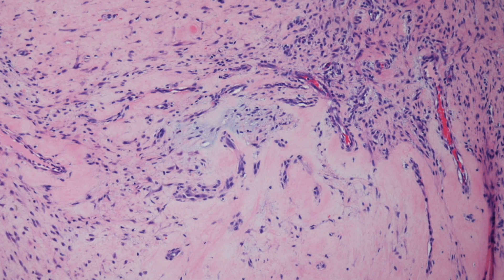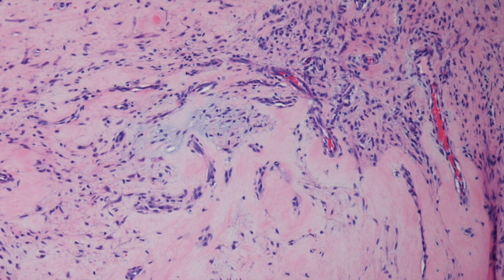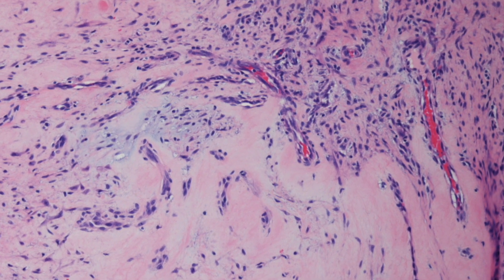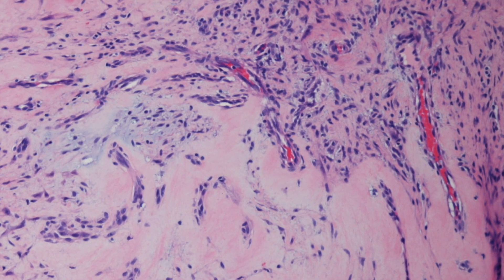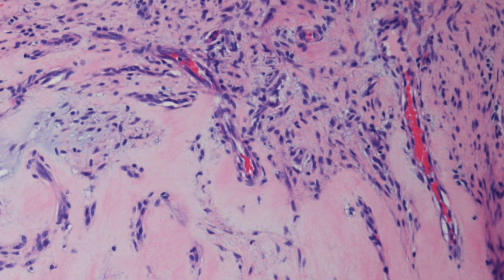In this part of the lesion you can see the slit-like blood vessels.